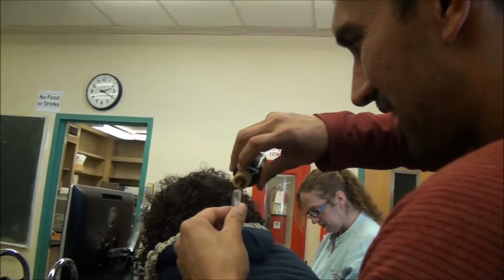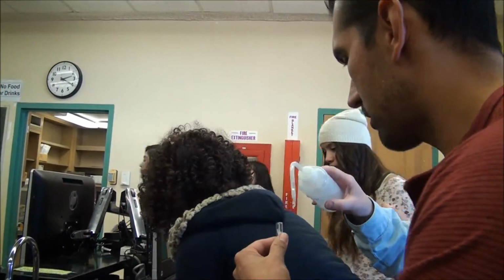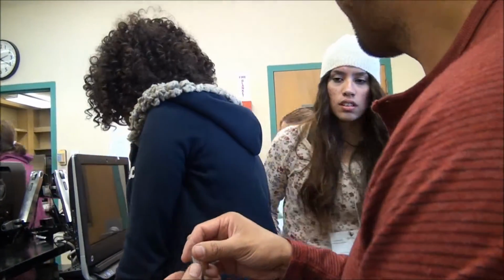What's this guy doing? What are you doing? I'm checking out Suspect 3. Suspect 3? Iodine. With iodine. Okay, what do you think it is? Couple of drops of water. Couple of drops of water. Okay. Whoa. What happened? What happened?